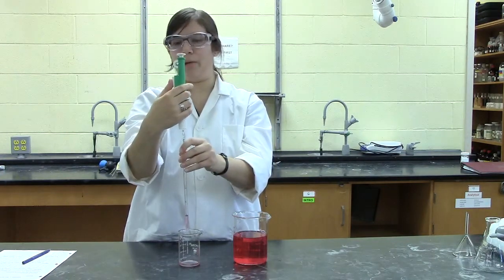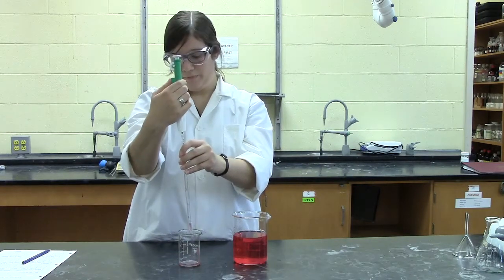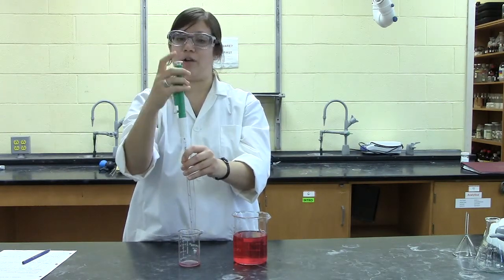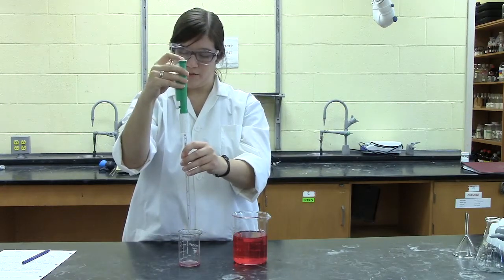Then you can void the whole pipette by clicking on this button to drain all of the solution. To get that last drop out, simply press down on the top to blow that drop off.